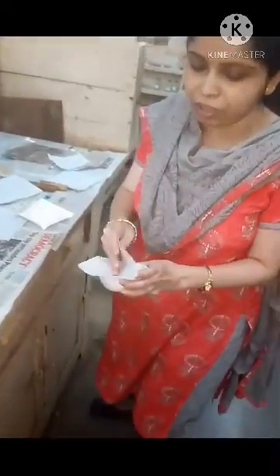Then transfer the phthalic acid into a clean and dry porcelain dish. If it is not dry, make it dry using filter paper. Then transfer this 2 grams of phthalic acid carefully into the porcelain dish.